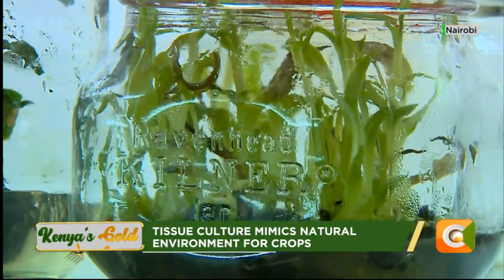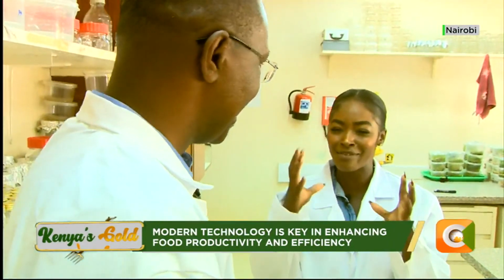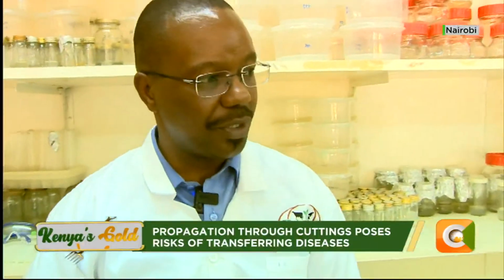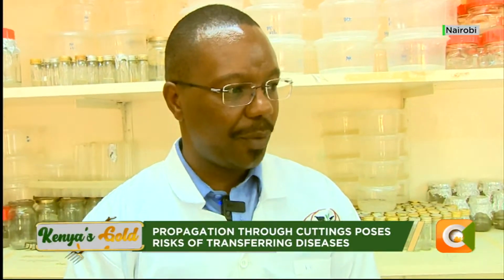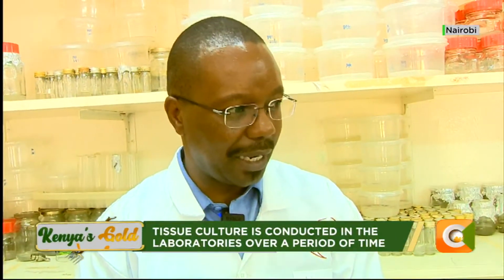Right. Yeah. I'm very curious to understand, what is that protocol? What does it entail? Where is the approval coming from? Just give us a little bit of insight on that. Oh, thank you. The protocol I mean here is the process it takes to produce that crop. Because we call it tissue culture, because you are taking a part of the tissue, not the whole plant.